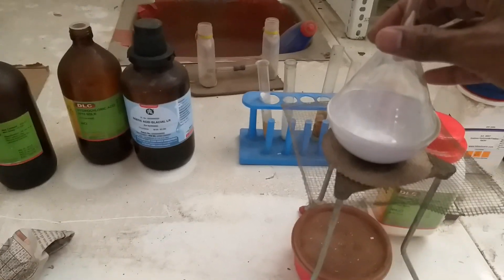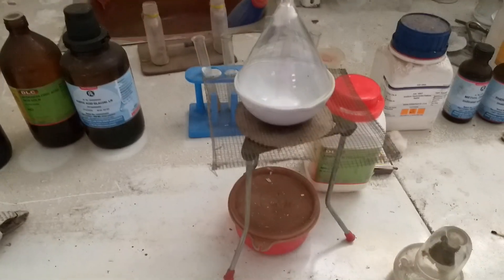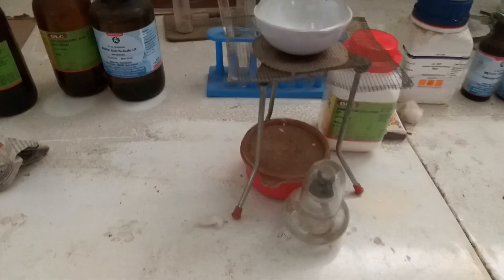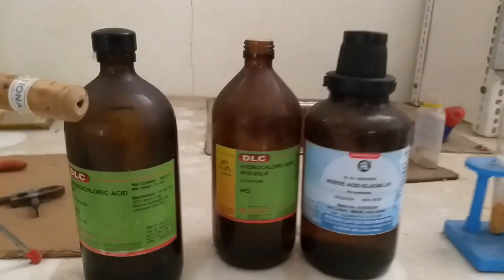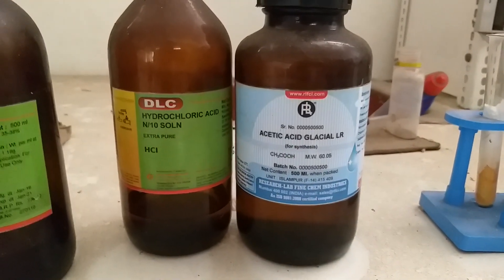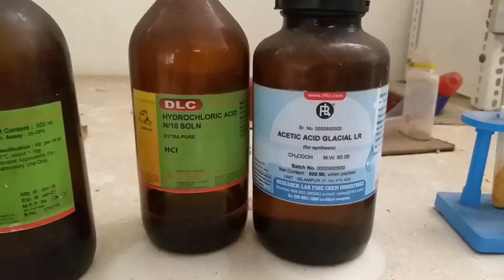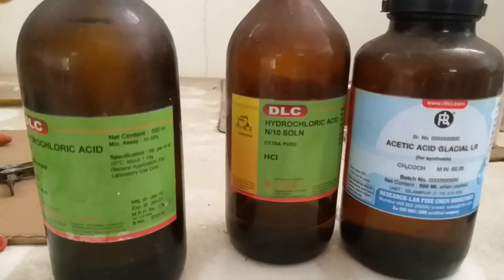Ammonium chloride and iodine can be used for sublimation. This is a spirit lamp used for sublimation. These are some acids — acetic acid, which is vinegar, also called glacial acetic acid. Hydrochloric acid is a normality by 10 solution.